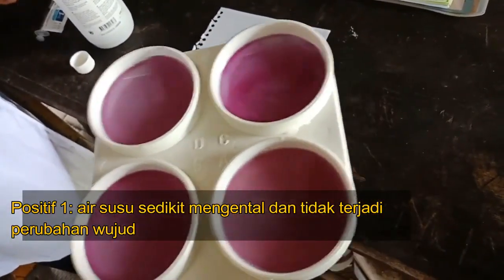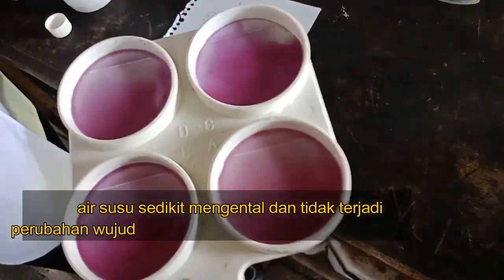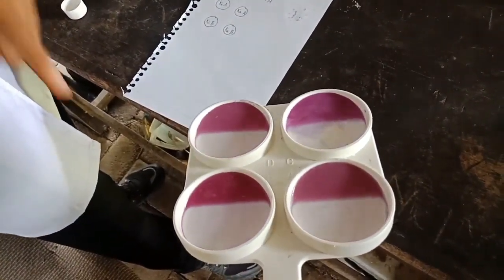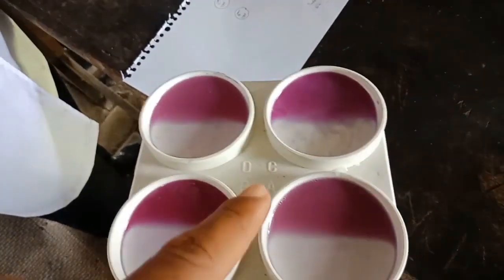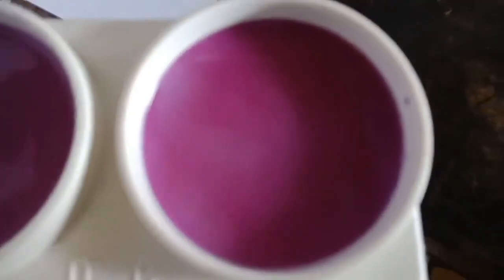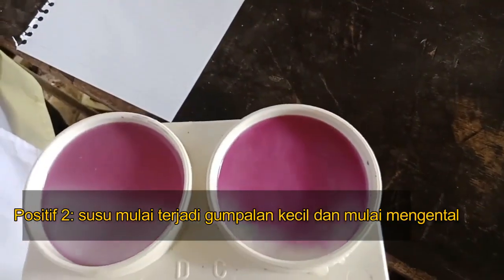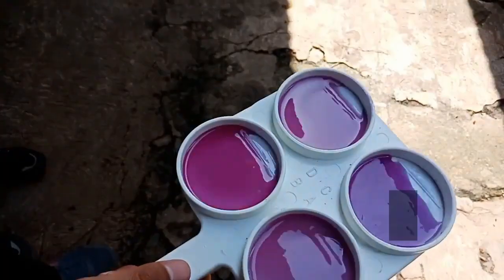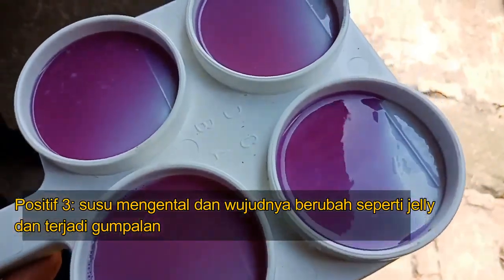Positive 1: milk is slightly thickened and there is no change in form. Positive 2: milk begins to form small clumps and begins to thicken. Positive 3: milk is thickened, shaped like jelly, and is lumpy.